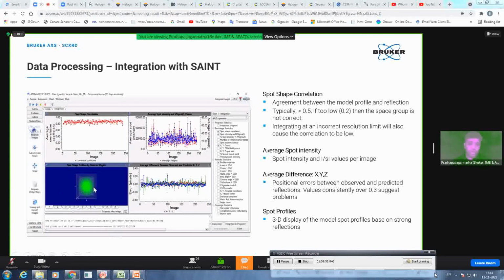And the fourth or final graph we are looking at is the 3-dimensional model profile. If the box size is good, you should see this box filled up with green spots. If the box size is too small, it tries to come out and becomes white. If the green is too small at the center, you know the box size is too big, and then you might consider changing the box size as well.